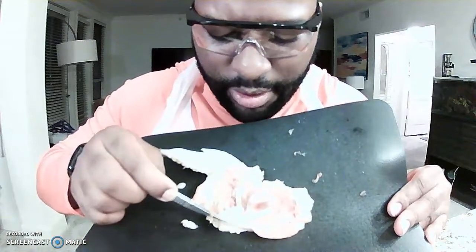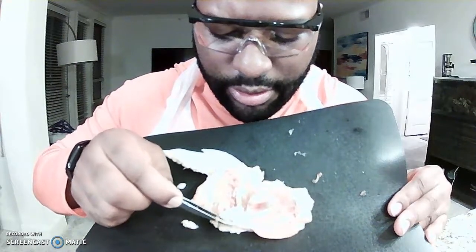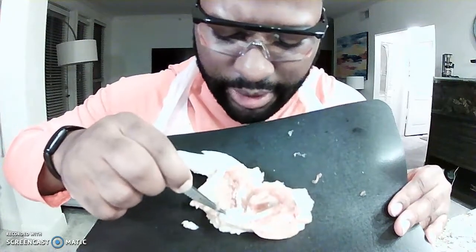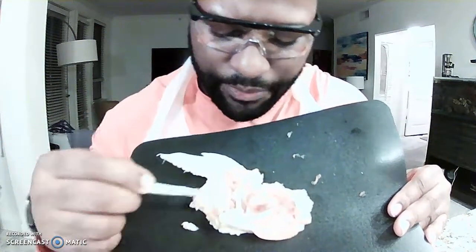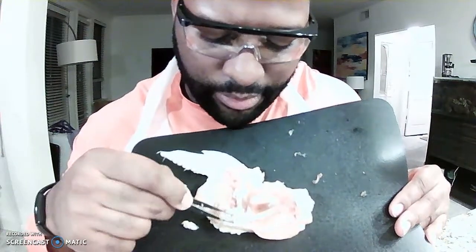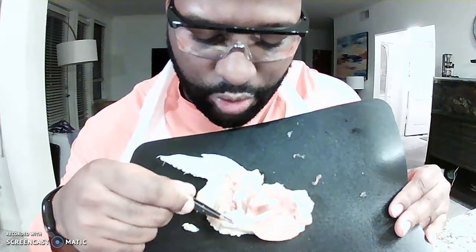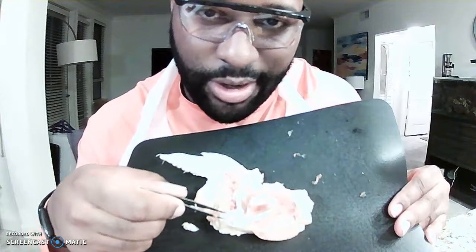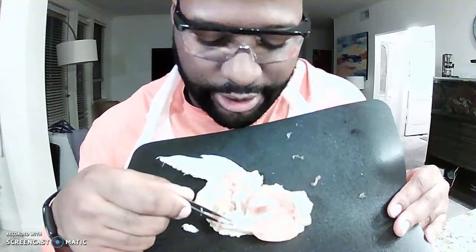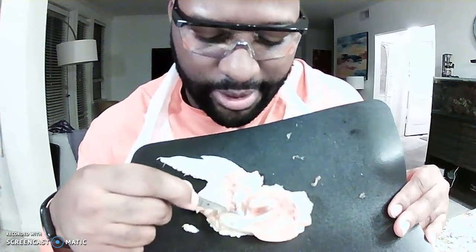This white sort of pearly piece is the articular cartilage. This is obviously the synovial joint itself, or synovial capsule here. On the inside of that, you'll have the synovial membrane. Within that synovial joint, you will have synovial fluid, which is what we see in our joints for reducing friction and providing nutrients, etc., mobility.